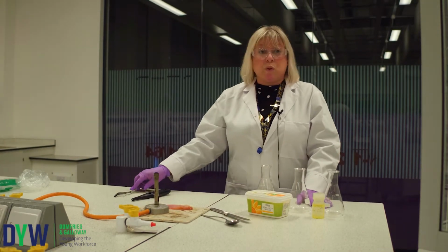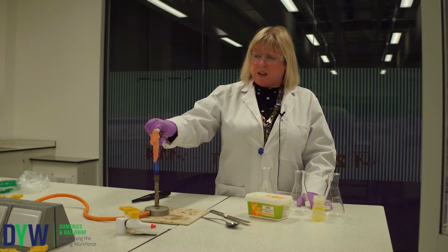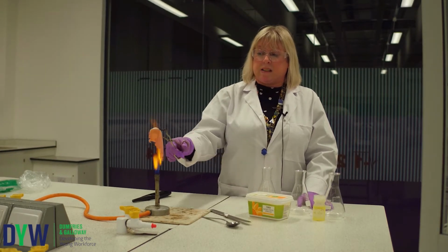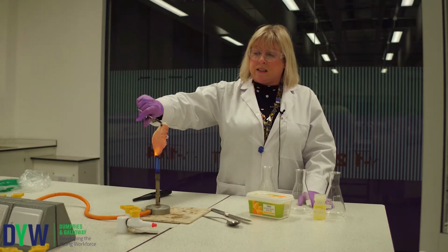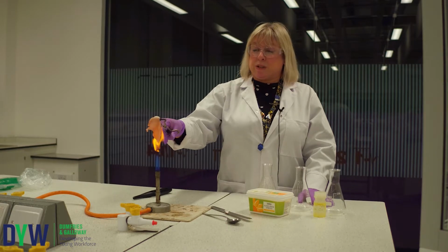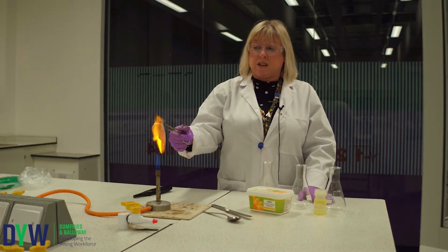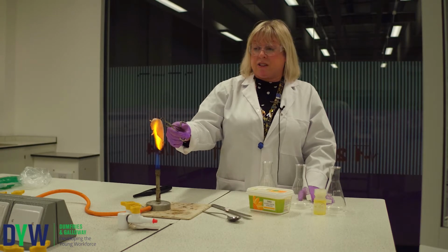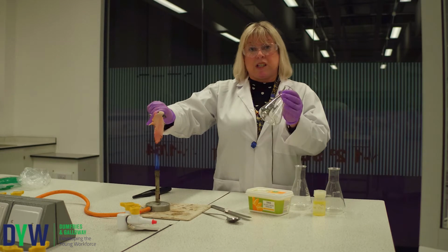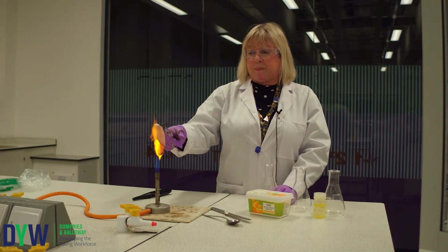Now today, I'm going to cook my bacon in a way I've never done before, on a Bunsen. So we're going to cook our bacon. We know that bacon contains fat because we can see it. The white is the fat. And we also know bacon isn't supposed to be terribly good for us. So does bacon contain unsaturated fats? Well, we're going to find out because I'm going to put it in one of these flasks and we're going to test it with bromine.